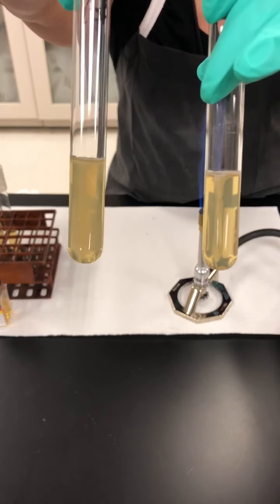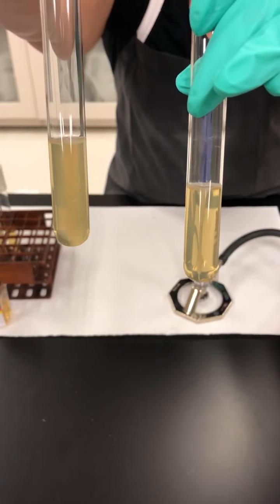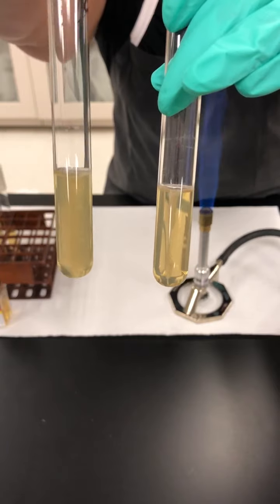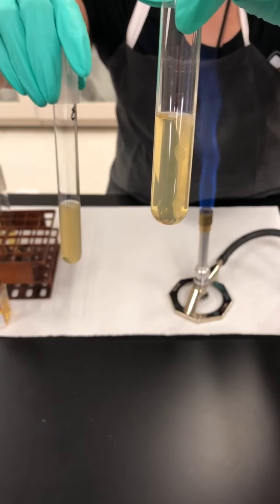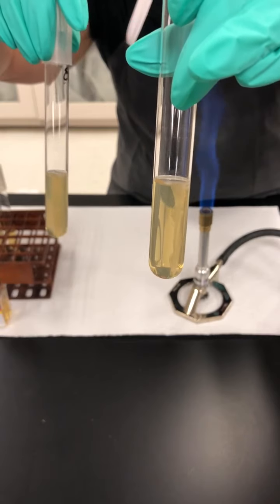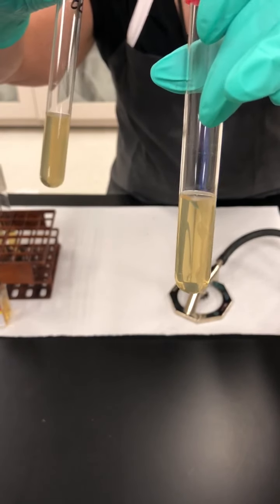Now, for the motility, we're going to look for radiating growth. The tube on this hand actually has this turbidity, is murky looking. That is your E. coli, it is motile. The tube on this hand is Klebsiella pneumonia. Notice that there's just a single line in the inoculation line. Those little bubbles is because the environment is anaerobic, so it is gassy, but it is not motile.